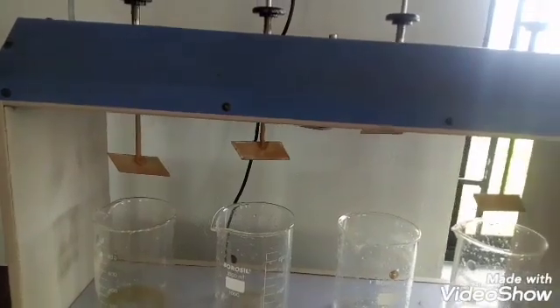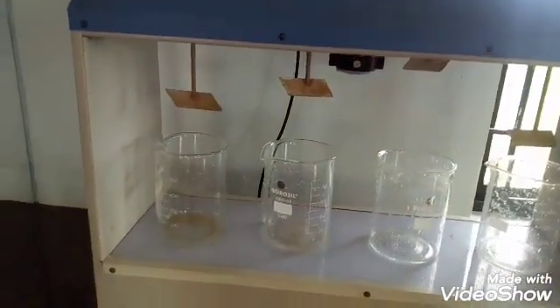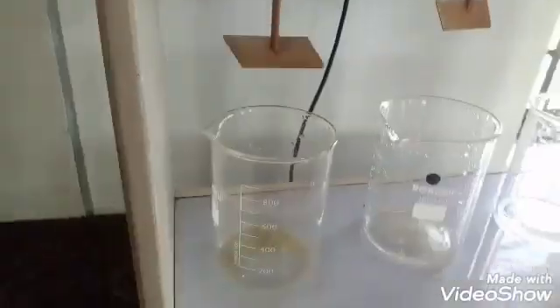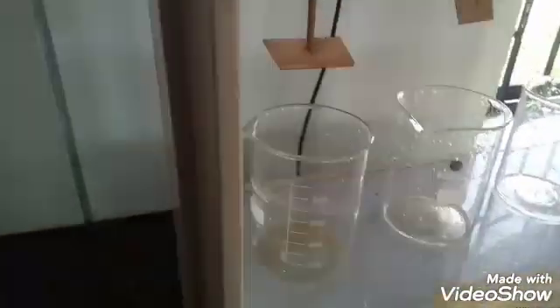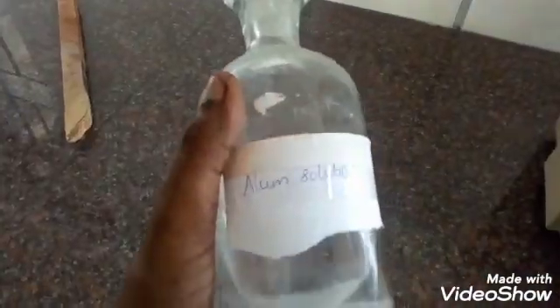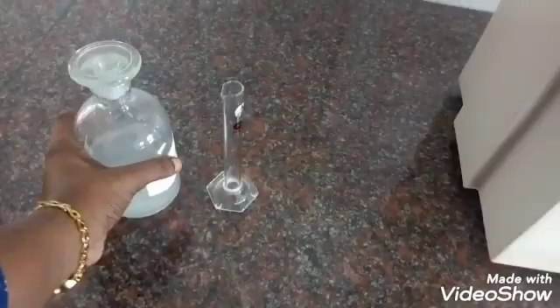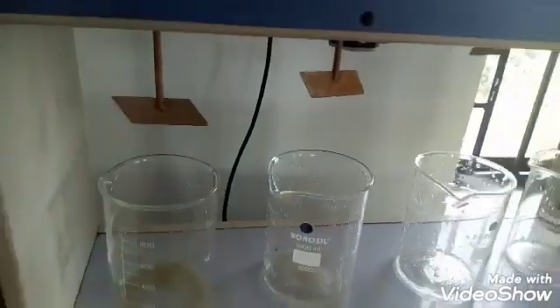This is a coagulant. This is an alum solution. This is a Jar Test. How to use coagulant.